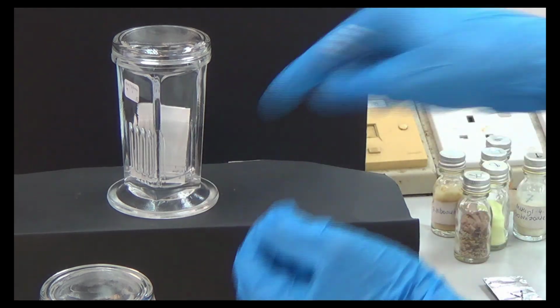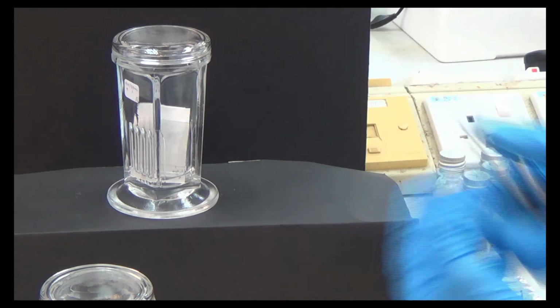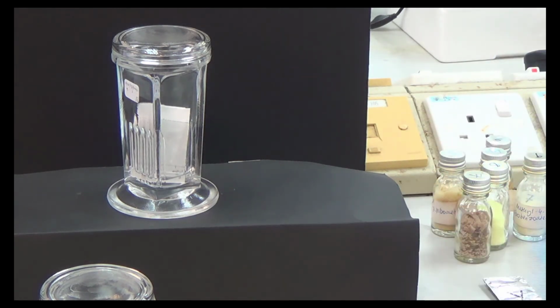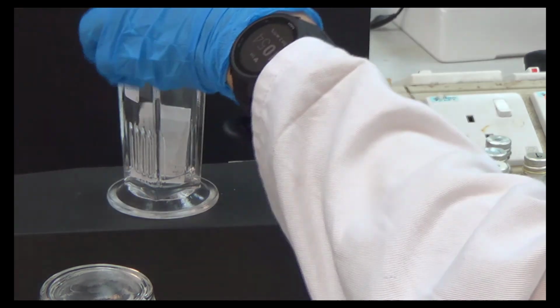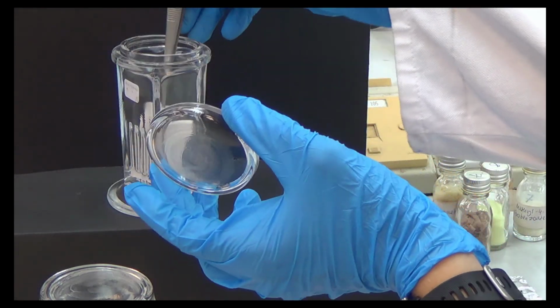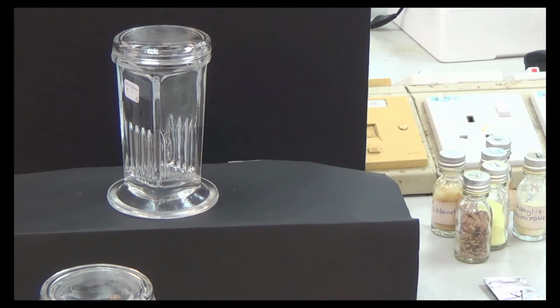If you just use the same mobile phase for everything, then you cannot. You just stay there. It will not separate. So that's the idea. Now you can see it's already at the end. So that's good, we take it out. So that's basically TLC. Now, let me change the camera first.